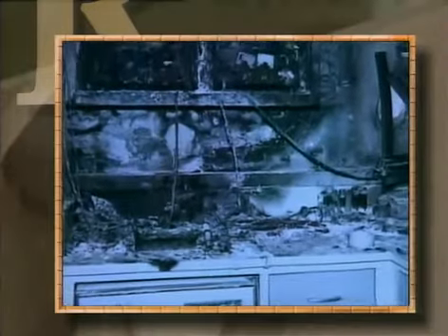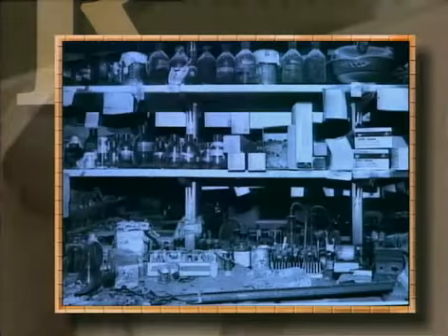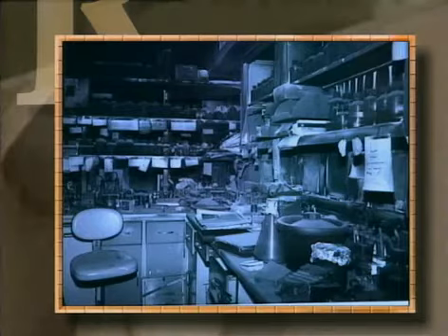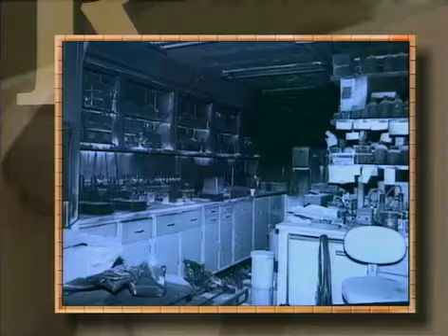The investigator had gone home for the evening, leaving his gel running. A modern device would have shut off before the buffer evaporated. The experimental work in progress of several investigators was destroyed. The lab was out of service for weeks.